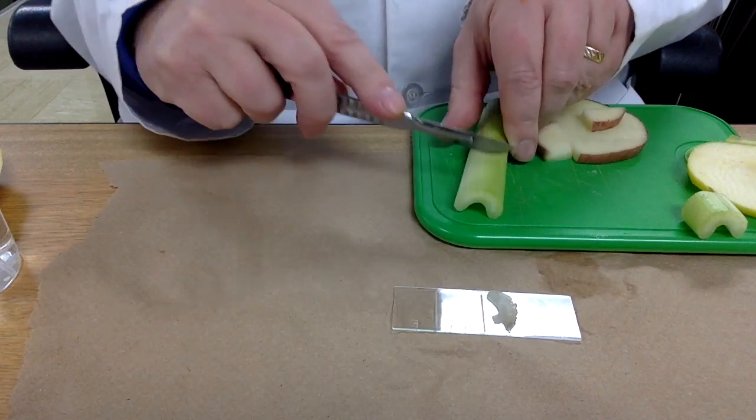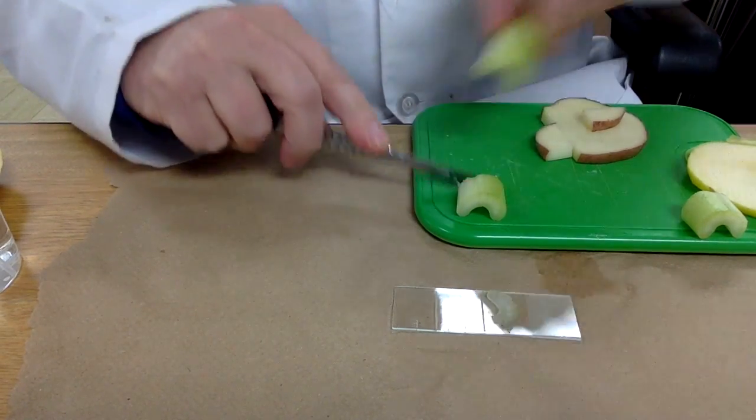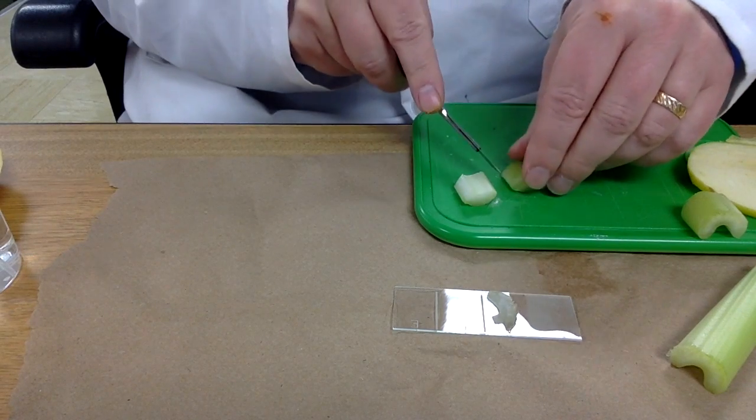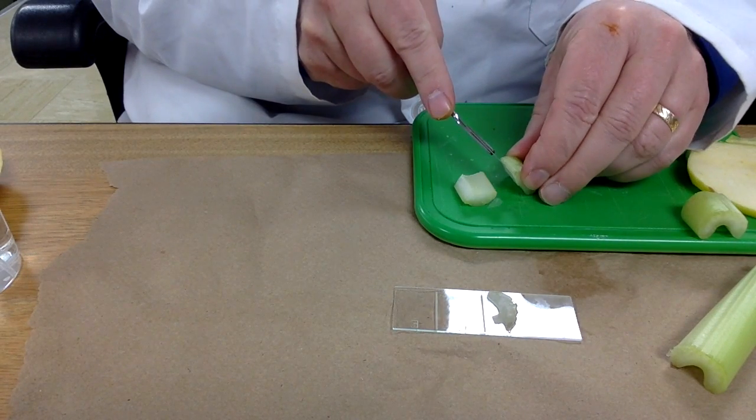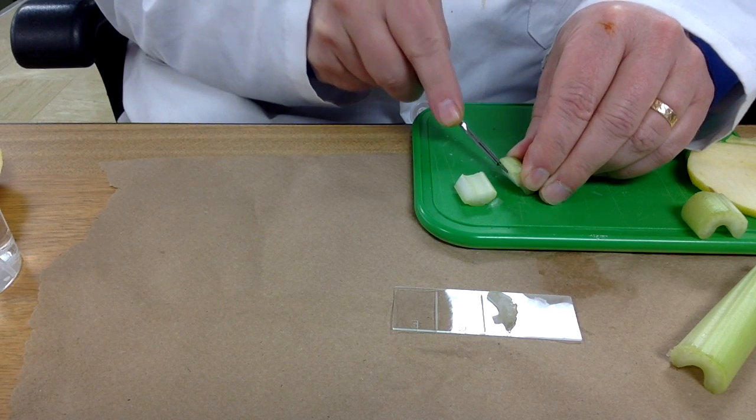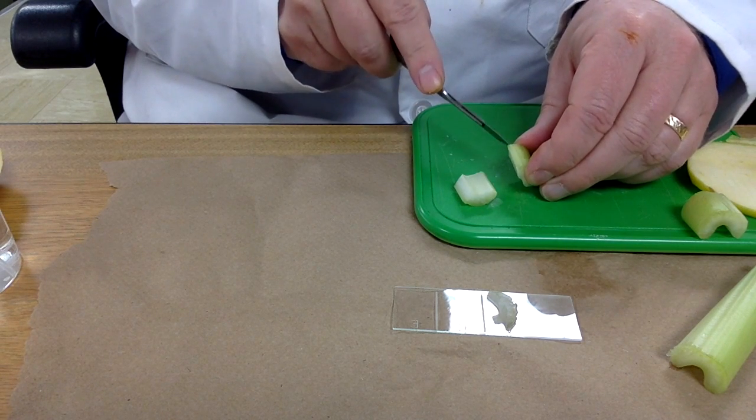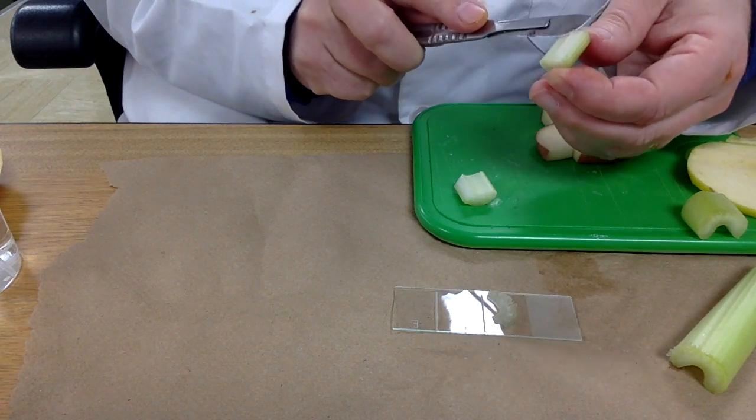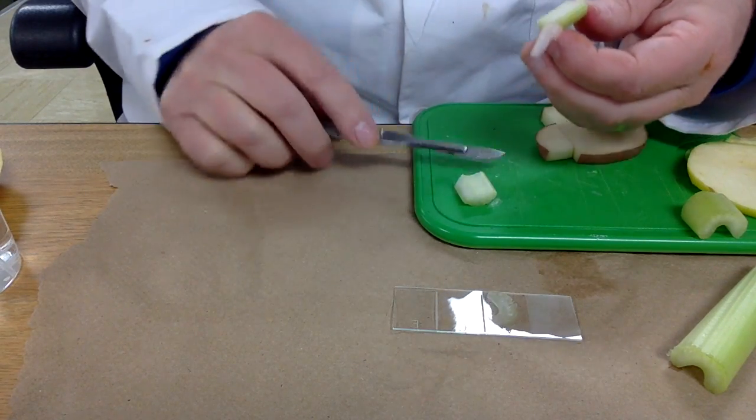Just start with a cross, come back for the long way. Get a very, very thin sample. Now we've got a thin sample.